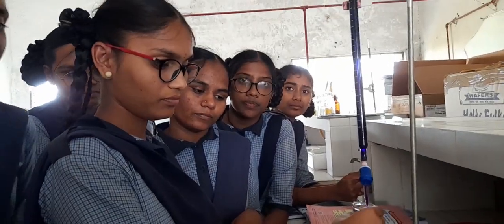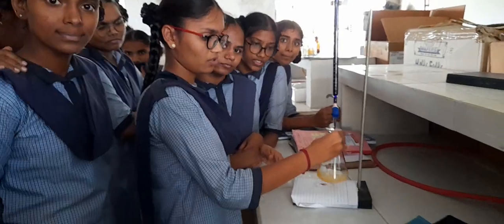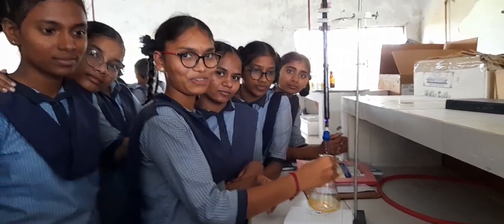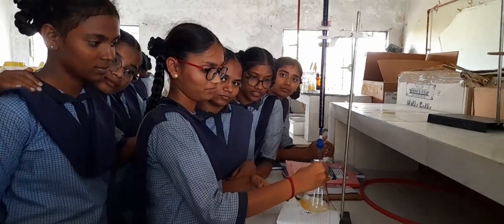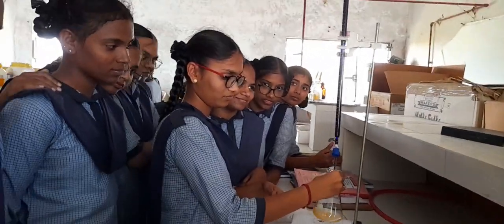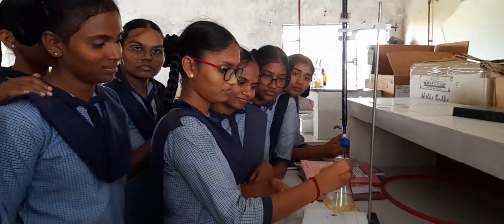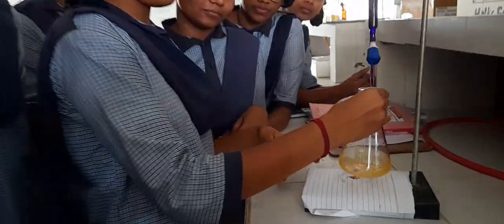So how many ml did you take? 20 ml. What did you add? Concentrated H2SO4. Dilute H2SO4. You have to be specific. Okay, don't get confused. So dilute H2SO4, 10 ml you have taken and you have started your titration. What is the initial color? Pale yellow sort of thing. Okay, good. So what could be the end point?